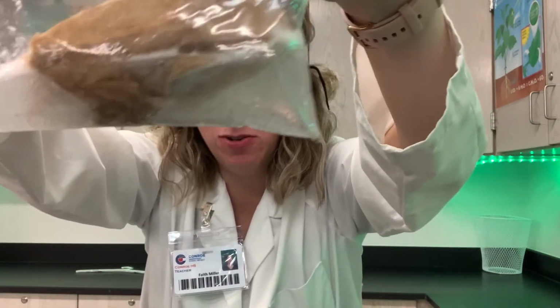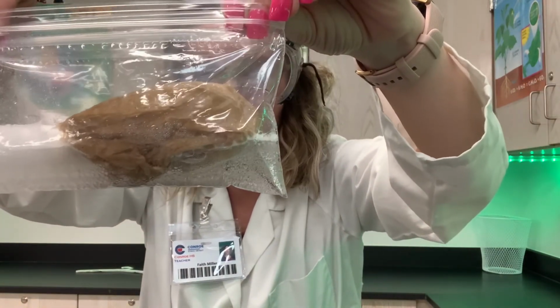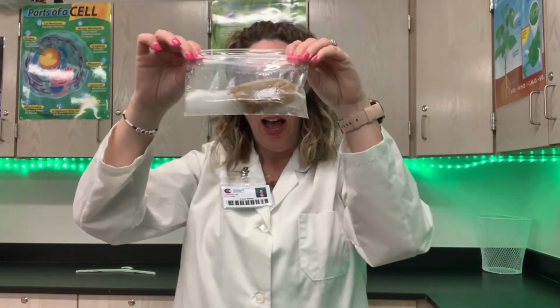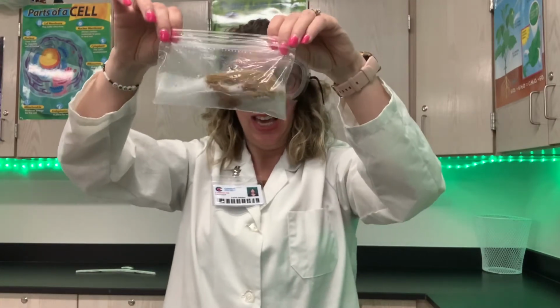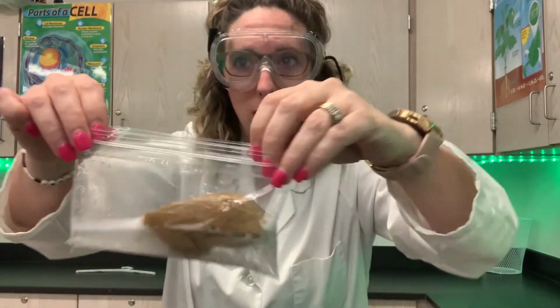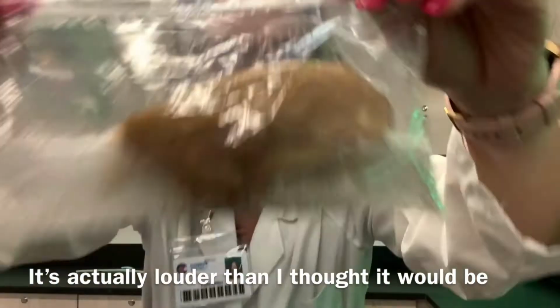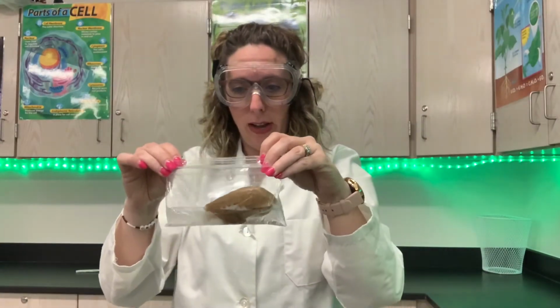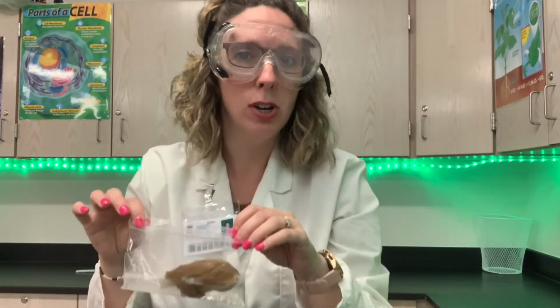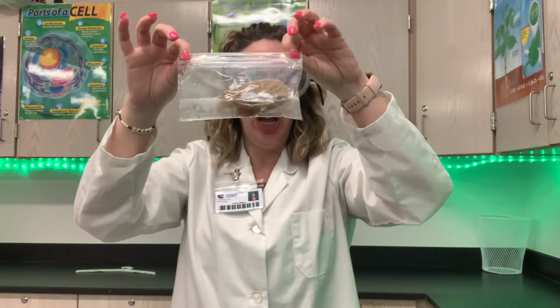And of course you can see all the bubbles. You can see it filled up very big and it was about to explode everywhere. So how do we know what kind of change is happening here? So let's take a look. Ooh, I can hear all those bubbles. Can you hear that? I don't know if y'all can hear that or not. I can hear it. So we've got all these bubbles going on, and bubbles are one of the main signs that let us know that this is a chemical change, okay? Bubbles also tell us that a new gas has been produced.